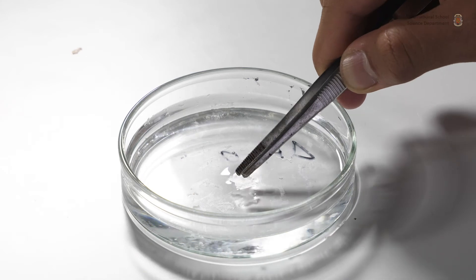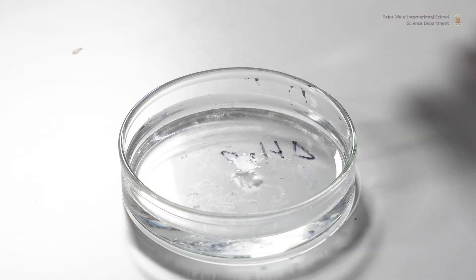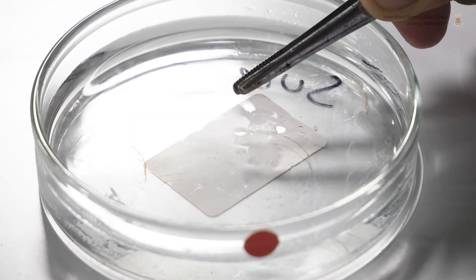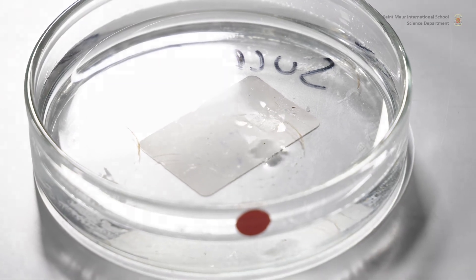Place your sections in treatment solutions, usually distilled water and one molar sucrose, and incubate at room temperature for 10 minutes.